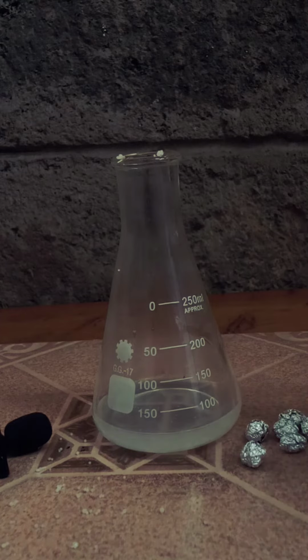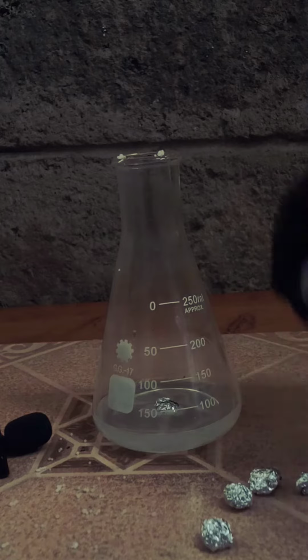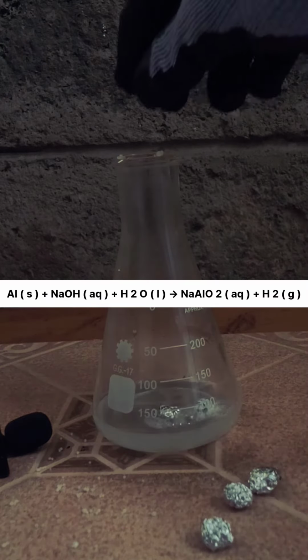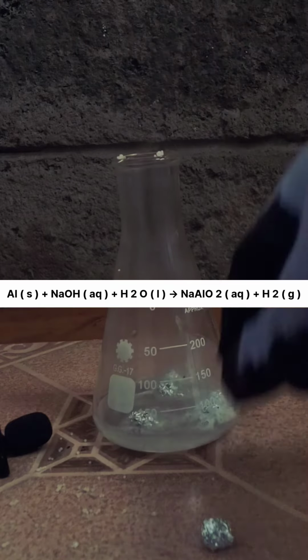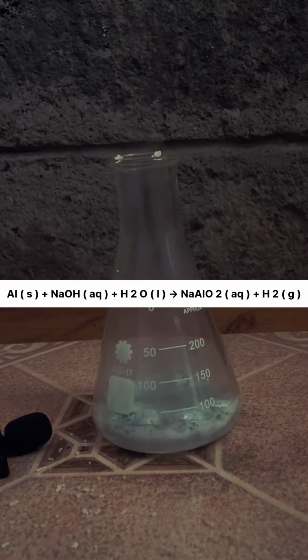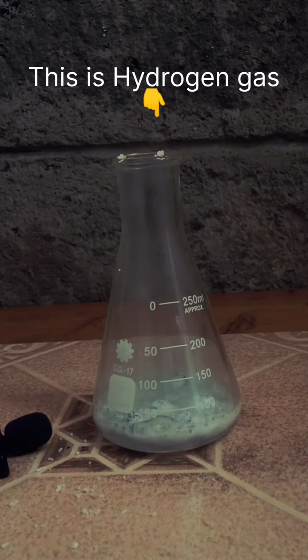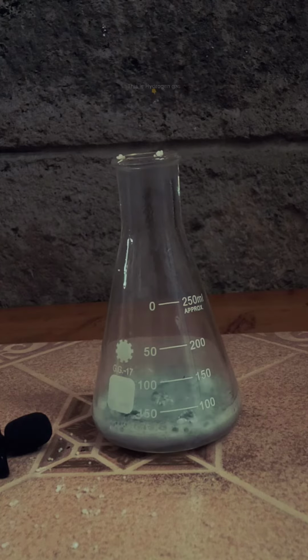Then throw in some aluminum foil, and immediately a reaction is going to take place. So basically what is happening is that sodium hydroxide reacts with the aluminum to give out sodium aluminate and hydrogen gas respectively. If you wish to carry out this experiment, make sure to do it in a well-ventilated room or else do it outdoors.